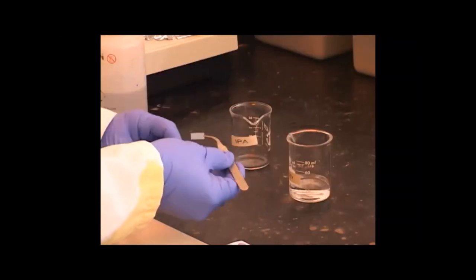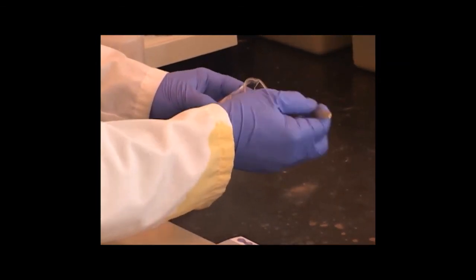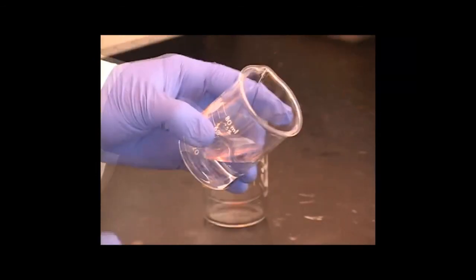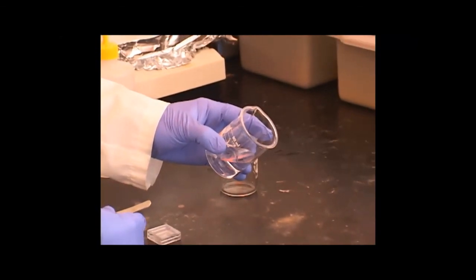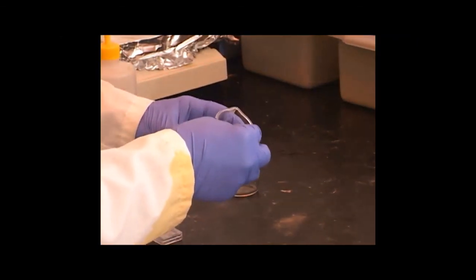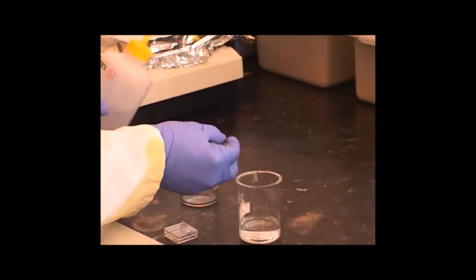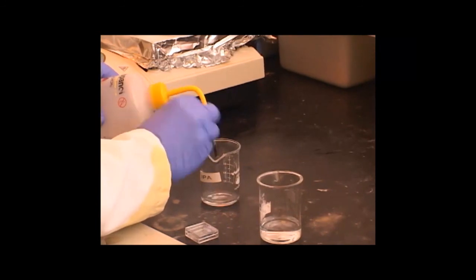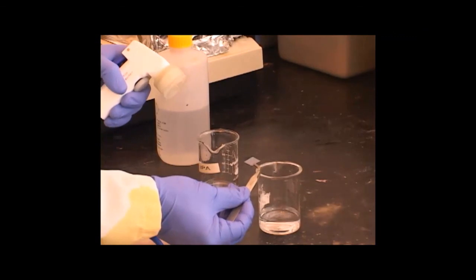After we've finished processing the run file, you can remove the chip from the chamber and take it over to the wet chemistry room for developing. The resist that we're using for our demonstration today is polymethyl methacrylate. It's a positive resist, which means the areas that are exposed to the e-beam, the bonds will break. And then after the exposure, we'll immerse it in a developer that's methyl isobutyl ketone in isopropanol. That developer will take the broken PMMA and rinse it out.